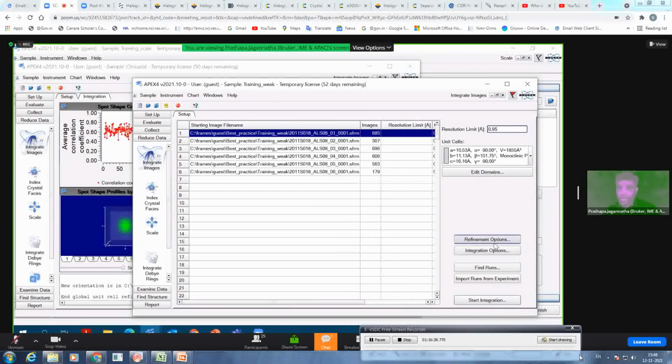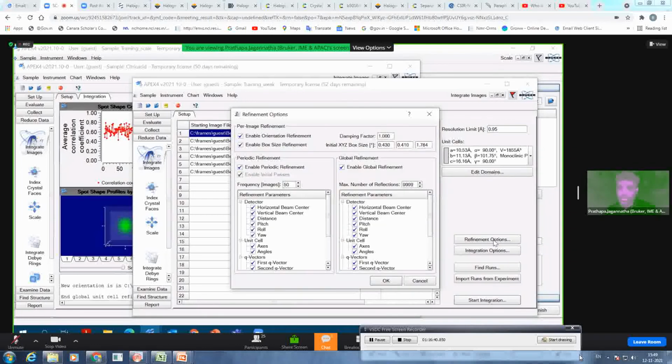And then you can go under the refinement option, because the box size is too small. You need to increase the box size. The first attempt I always make is to double the box size. Then if I know that this is too big, I will make it half. So for example, now I want to double, so I will make 0.8.